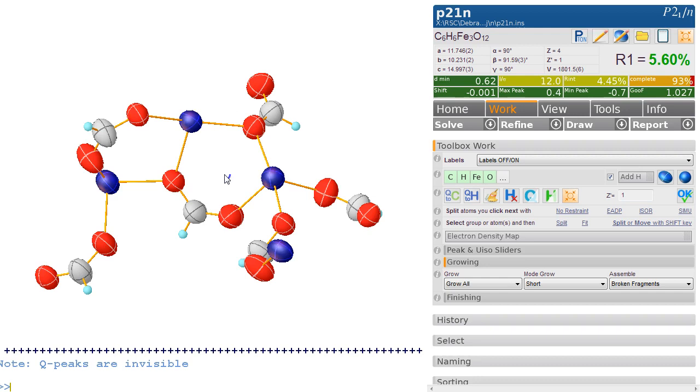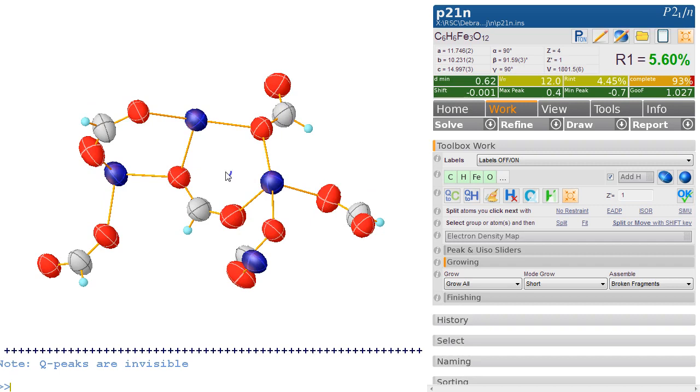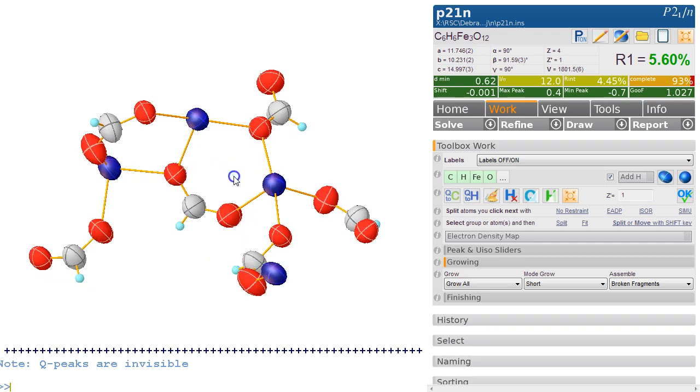But other than that, I think I've shown you how to get to the structure by a standard solution, electron density assignment, and chemical knowledge put in there. I'm not saying this is necessarily iron. It could be cobalt or nickel, or we don't know what was put in there. So without that knowledge, we have to consult with the chemist what's going on.